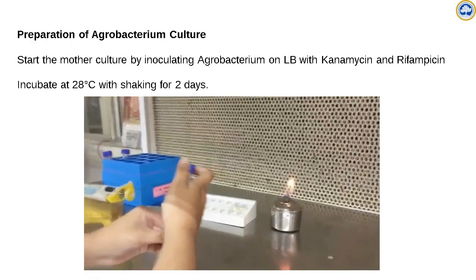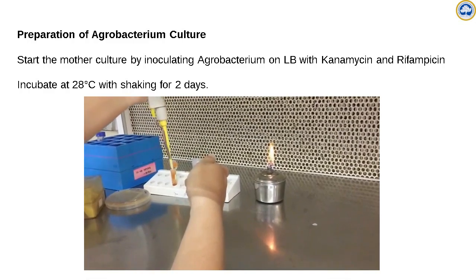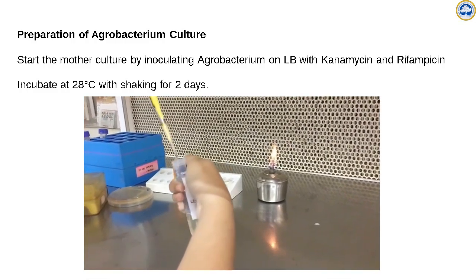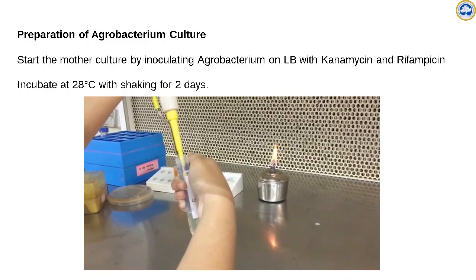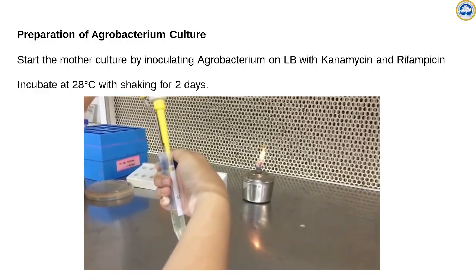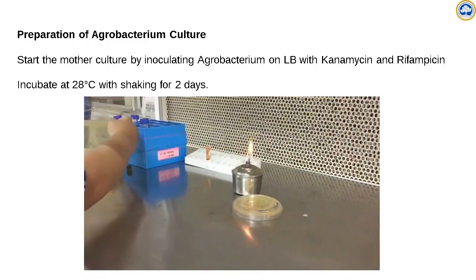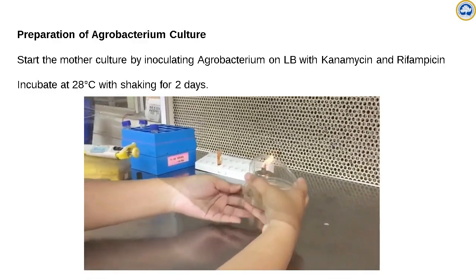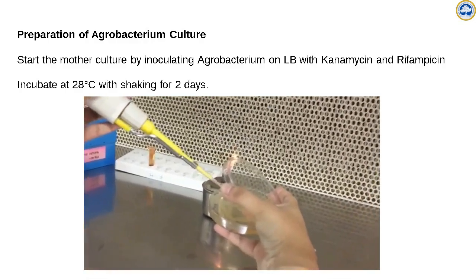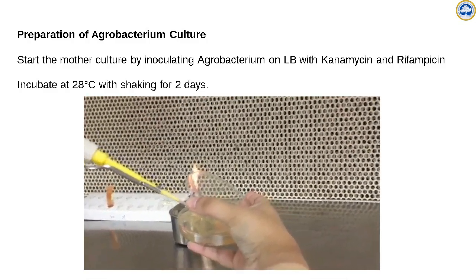The first step in this agrobacterium transformation of onion epidermal cells is the preparation of the agrobacterium culture. From a single colony, we prepare a mother culture. We take a single colony from the agrobacterium harboring the GFP fused to the gene of interest or the promoter under investigation, and inoculate it in 5 ml LB broth. The broth contains kanamycin selection at 50 microgram per ml and rifampicin selection at 10 microgram per ml.